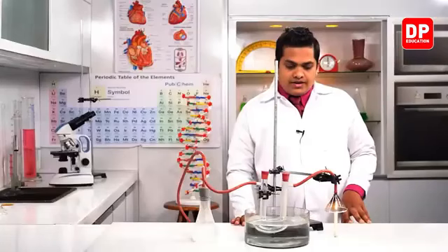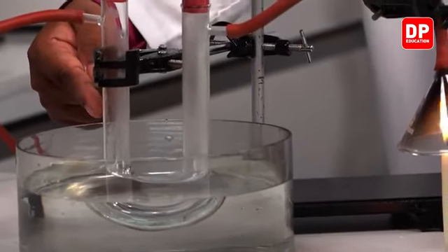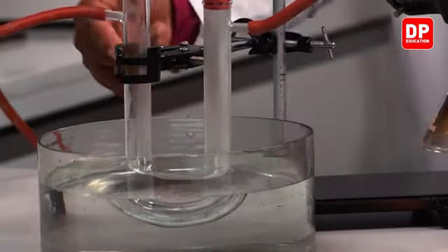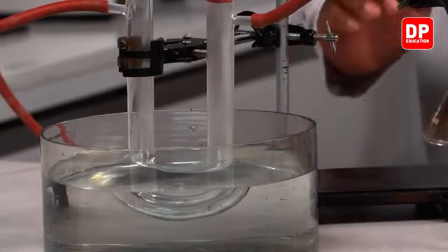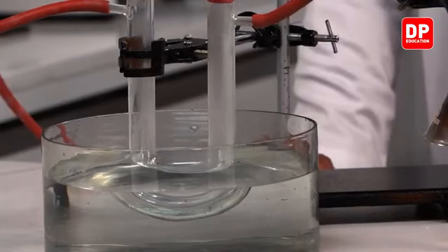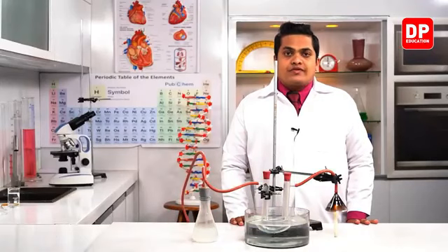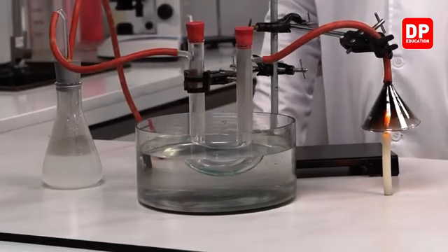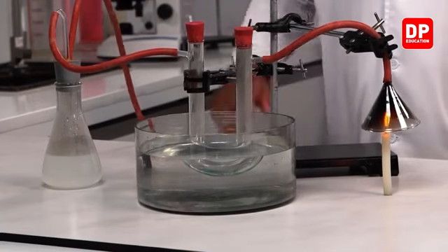And here also we can see that gradually the copper sulfate crystals are getting converted into a light blue color. See? Gradually it's getting converted into light blue color. So we'll give it some time and let's observe. Right, my dear children. Now here you can observe our observations very clearly. I have let it run for some time and now we can observe much clearer observations. So here you can see the copper sulfate solution.